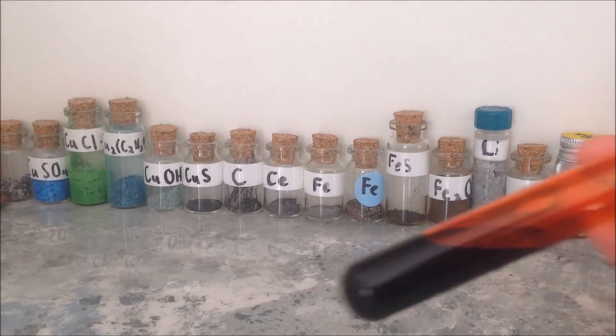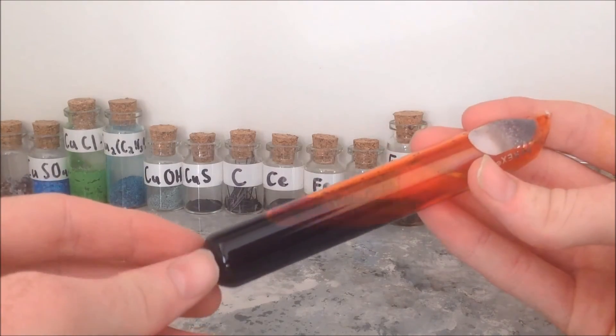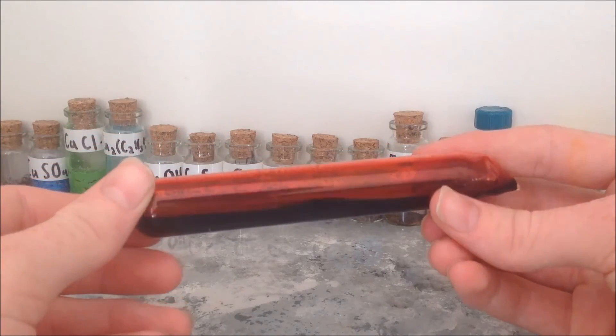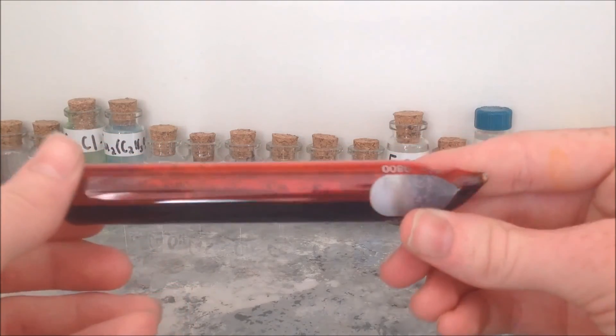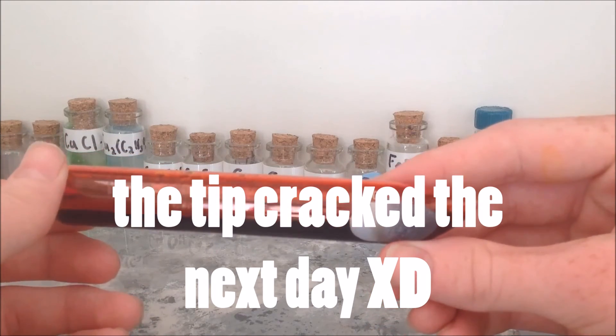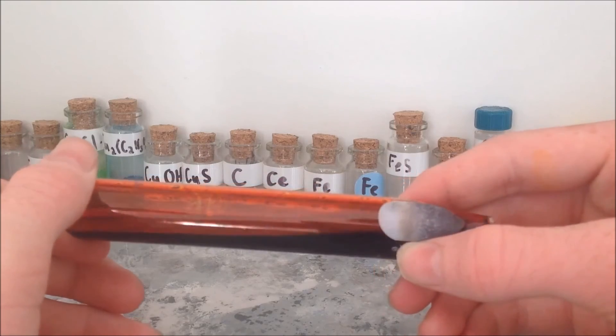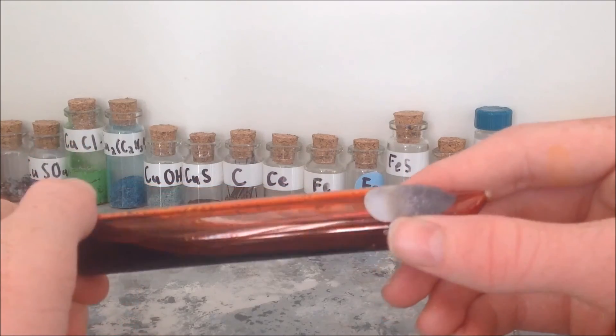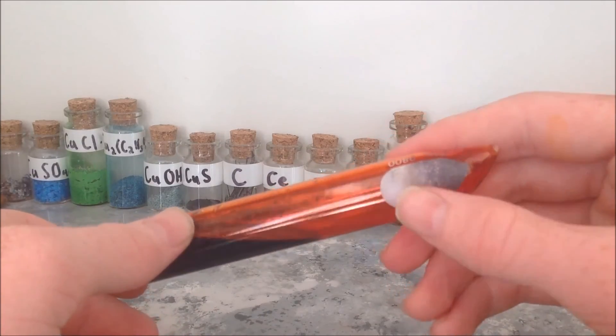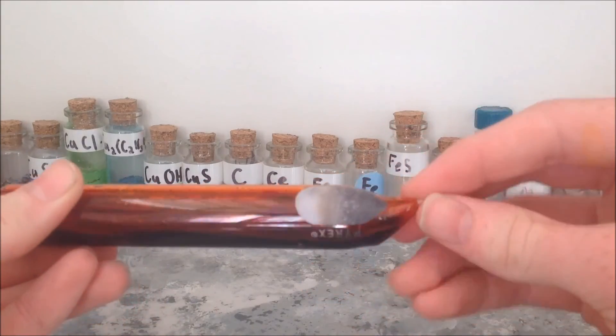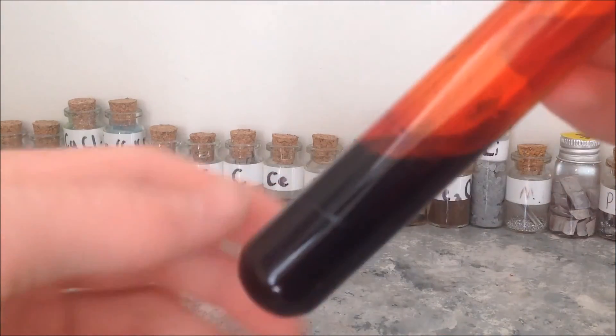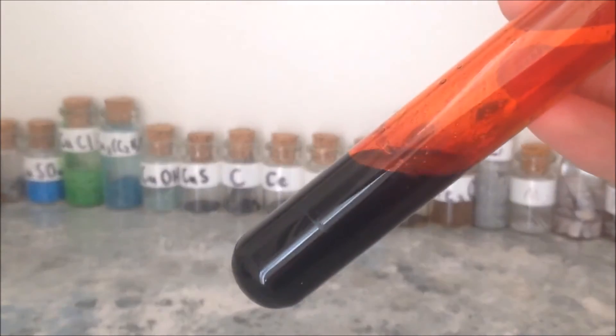As you can see, I've finally ampulled the rest of my liquid bromine. You may be able to see that I've professionally ampulled this as well. No, just kidding. But what I actually did was I took a Pyrex test tube and filled it with the rest of my bromine, and I torched the end and pulled off the top of the test tube, and it looked like this, and we got pure bromine. And you may be wondering how much it actually is.